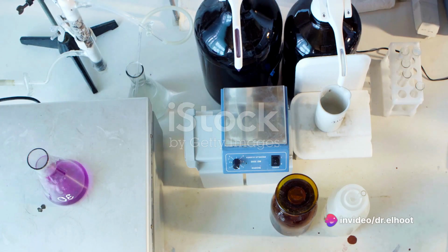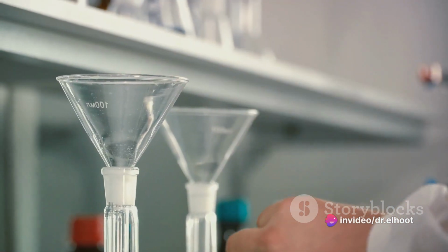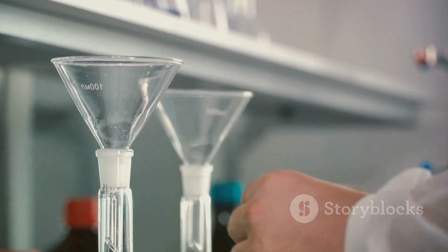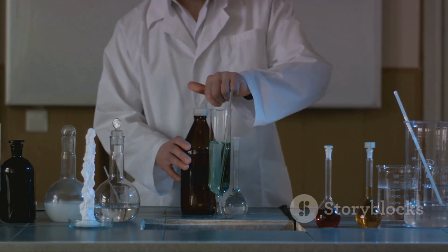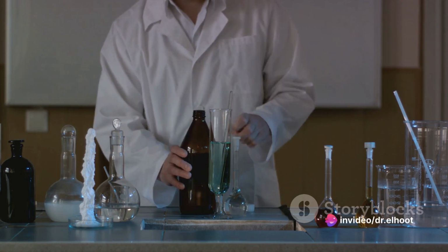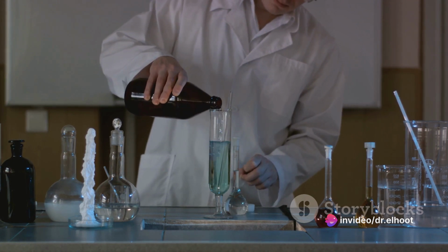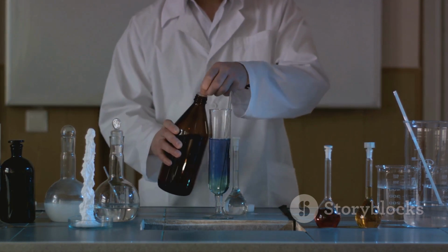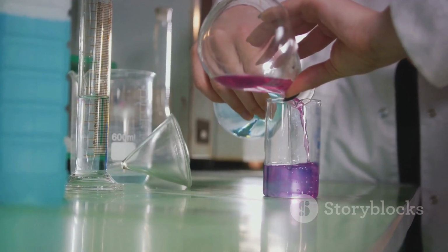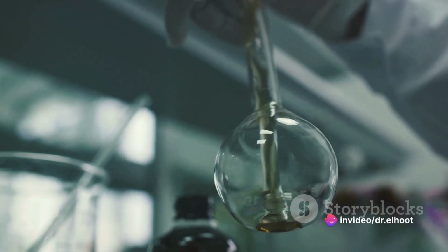Now the magic begins. You gradually start to introduce about 0.01 M EDTA to the mix. As you add the EDTA drop by drop, it begins to react with the free zinc ions. The EDTA has a higher affinity for zinc than the EBT, so it displaces the EBT in the zinc-EBT complex, forming a more stable zinc-EDTA complex. As this reaction progresses, the color of the solution starts to transform. It's a gradual change from a dark wine red to a mixed hue of wine red and blue.